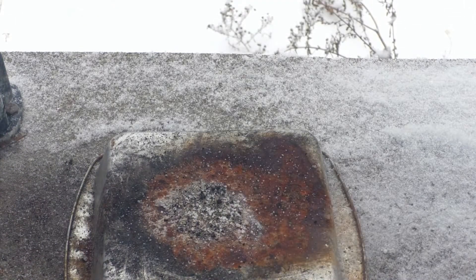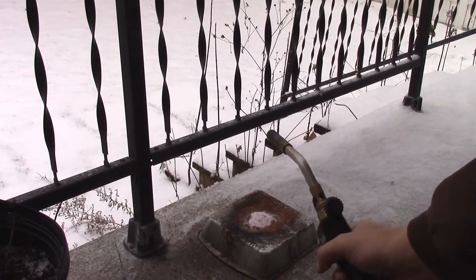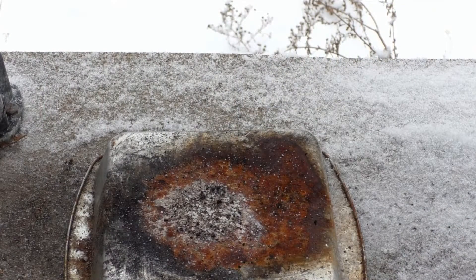It smells like smoke. It went up quick — burned quite vigorously, not too surprising seeing as candy cane is literally probably 99, if not 99.9 percent sugar and a little tiny bit of artificial flavoring. Yeah, it worked well, pretty much how I would have expected it to.